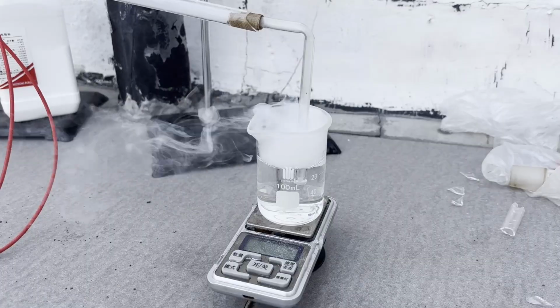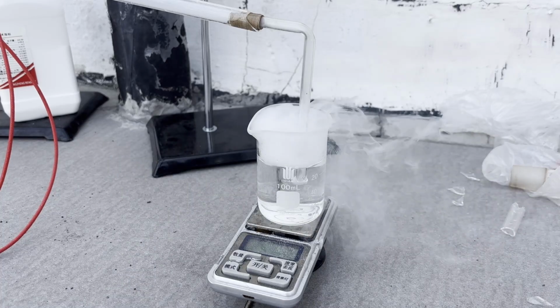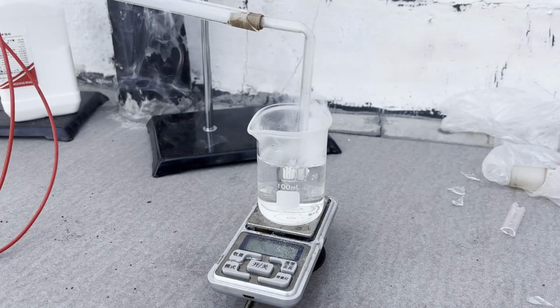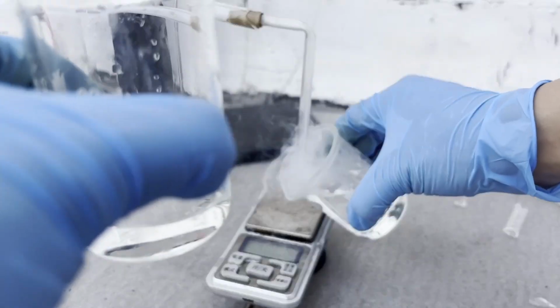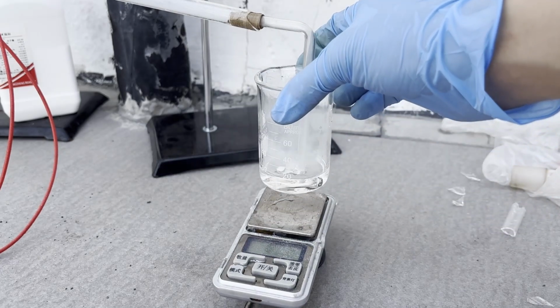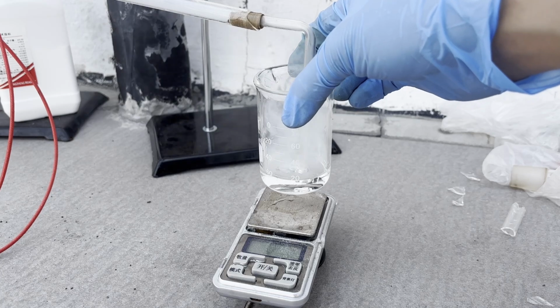The other fact I observed was that the fuming diminished when I switched the absorbing liquid from water to 85% sulfuric acid. Passing the gas through water resulted in very dense white fumes that easily escape the beaker and can be visible from a far distance. But with the sulfuric acid, the fumes were much thinner and didn't really escape out of the beaker. As sulfur trioxide reacts with water to form acid mists, but dissolves relatively well in 85% acid, this acts as another confirmation that we made sulfur trioxide.